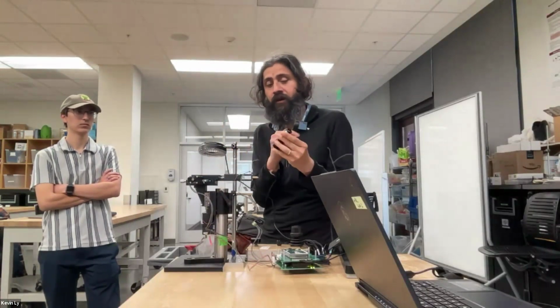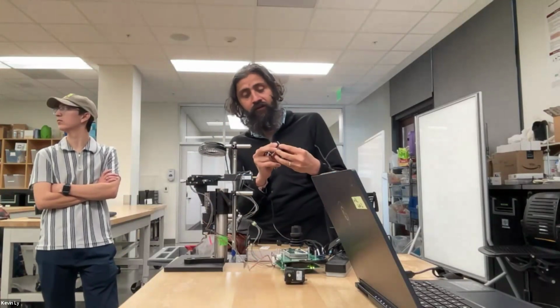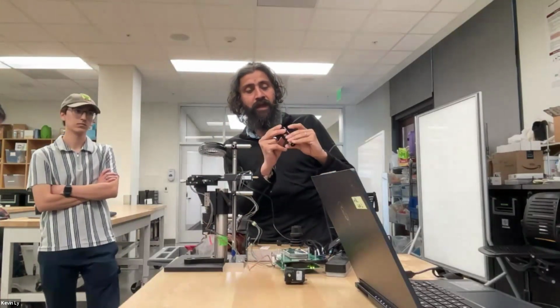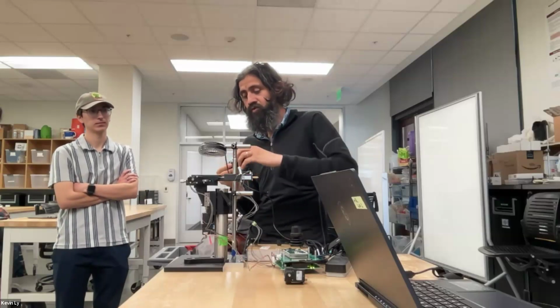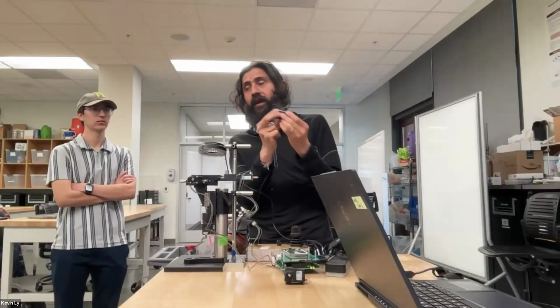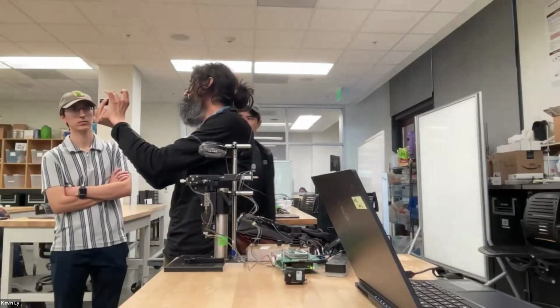So this is where, and then again, there is also an iris in here. The set of an iris will allow us to control the amount of light. There is also a degree of freedom that you can choose that'll allow you to change the distances associated. And then I'll let you see the iris for a second. So I'm opening and closing that iris.